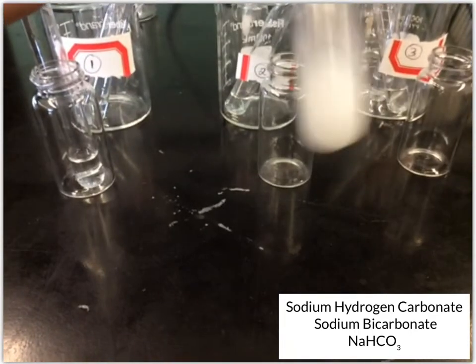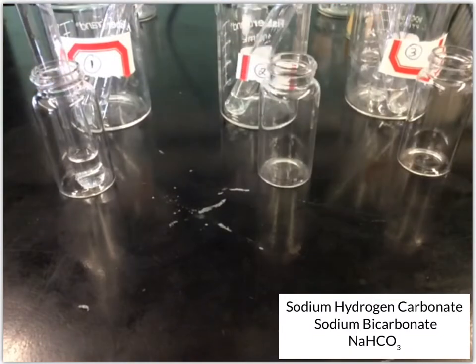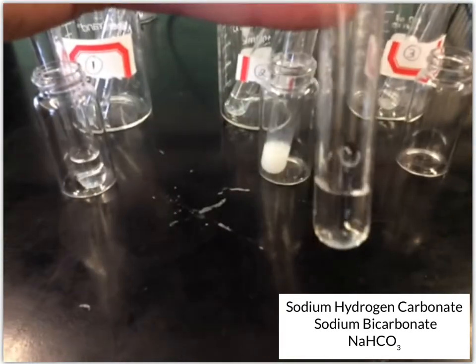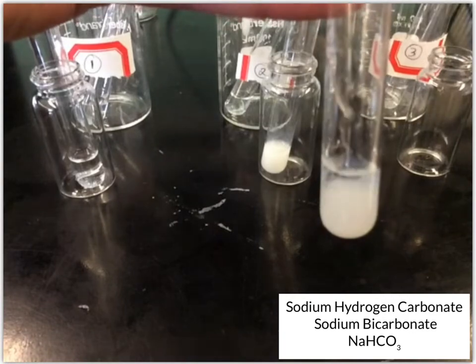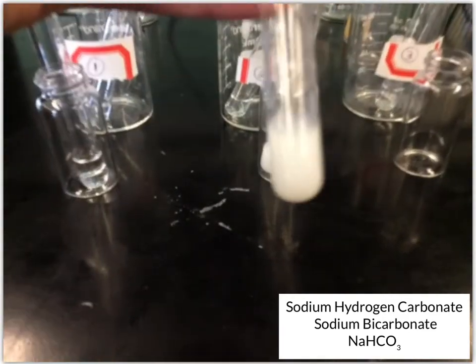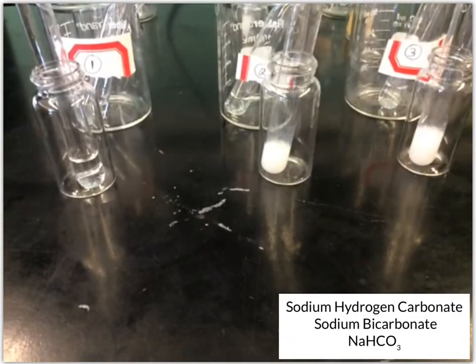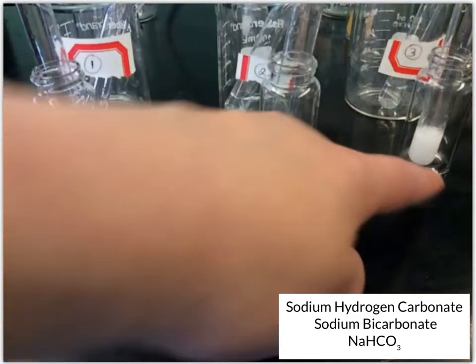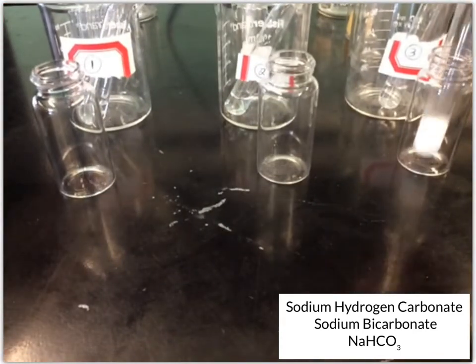Okay, and that one again formed some sort of white precipitate. And then number 3. Another white precipitate. So that's all with the sodium bicarbonate. You have no change with number 1 and white precipitates with numbers 2 and 3.